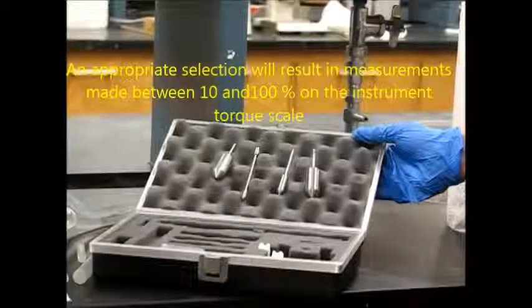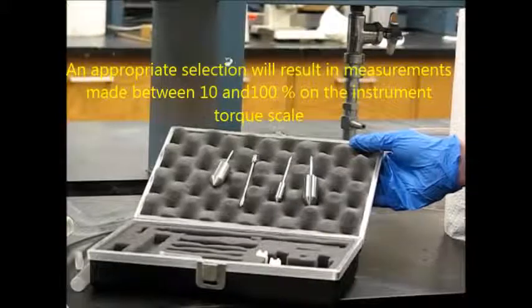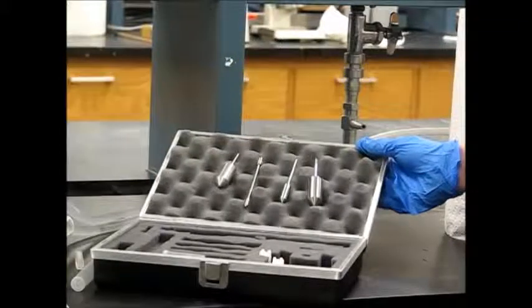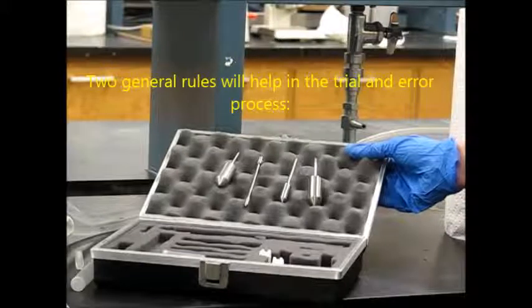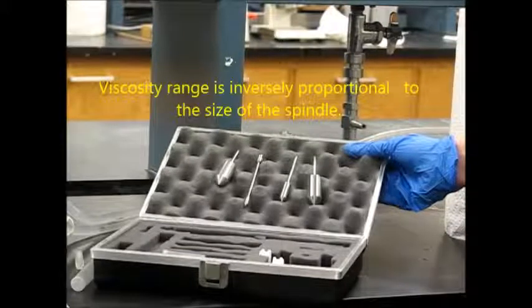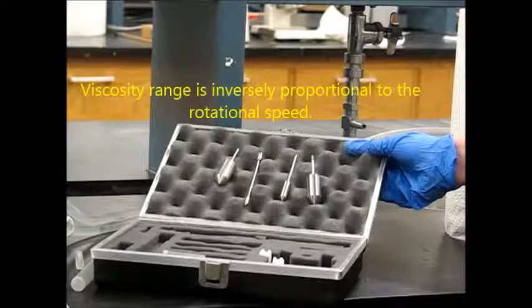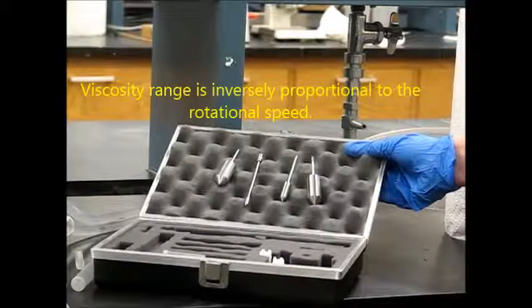An appropriate selection will result in measurements made between 10 and 100% on the instrument torque scale. These two general rules will help in the trial and error process. First, viscosity range is inversely proportional to the size of the spindle, and second, viscosity range is also inversely proportional to the rotational speed.